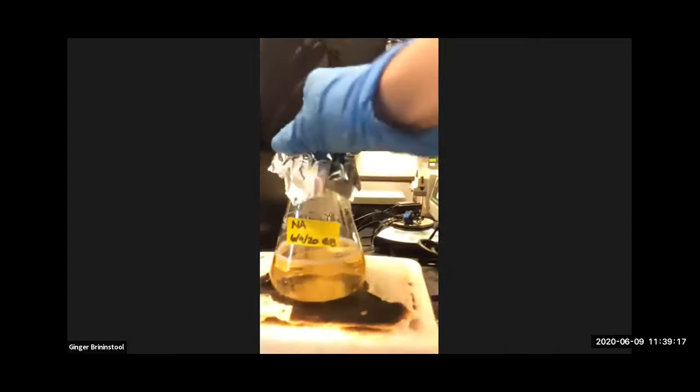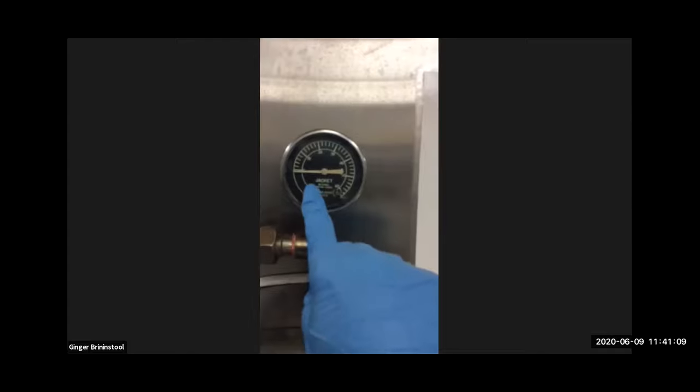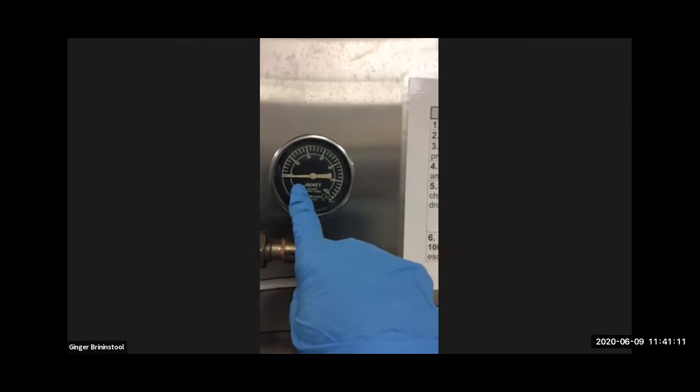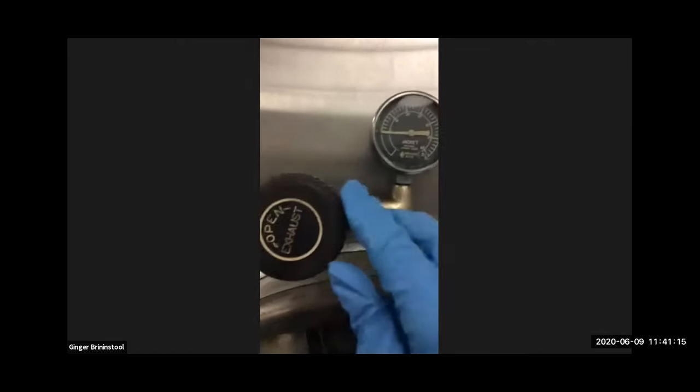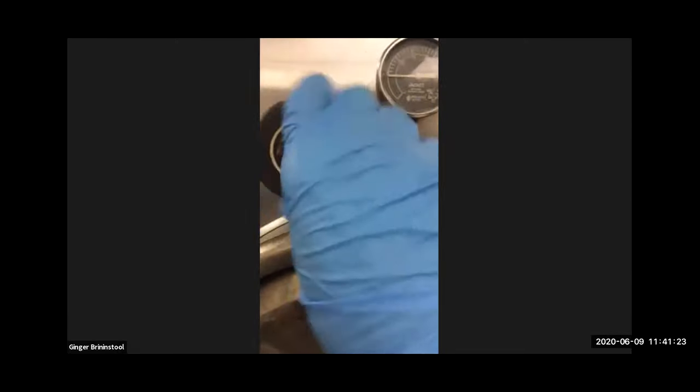And so this is the one I actually love to use. This is the manual autoclave. Some bells and whistles you should be familiar with. Up here at the top, this is the pressure gauge. Right now you can see it's at 0. I hope you can see that it's at 0. There's an exhaust valve. This one right now was open a little bit. When it gets to 0, this can be opened all the way. All right, it needs to be for our next purpose.